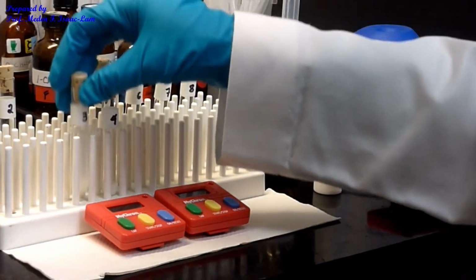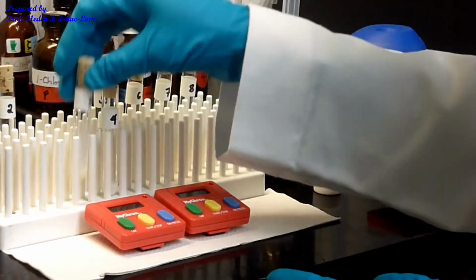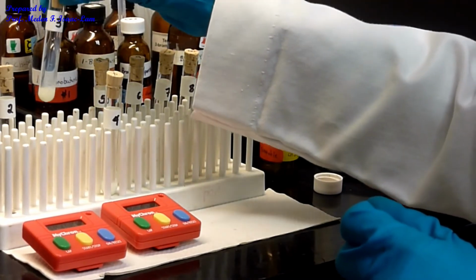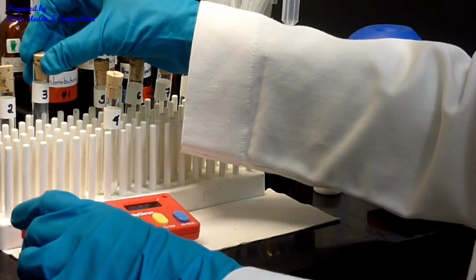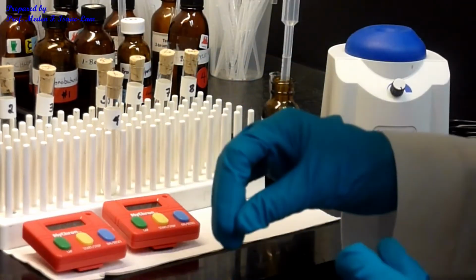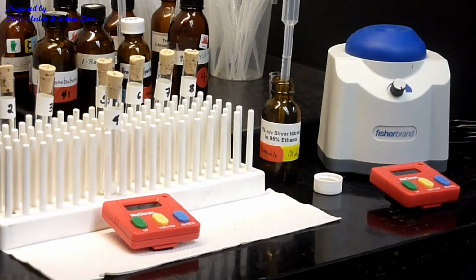And this is almost done also, but again, it's the most precipitate. Okay. So this is almost done, 5 minutes here. So a few more seconds, 5 seconds. And then I'll turn this, okay?